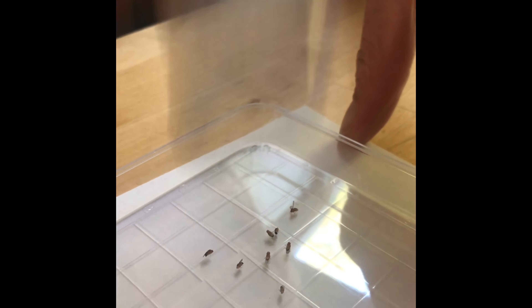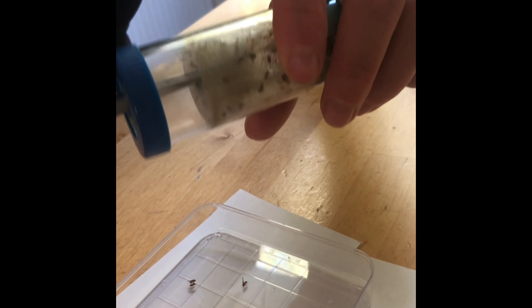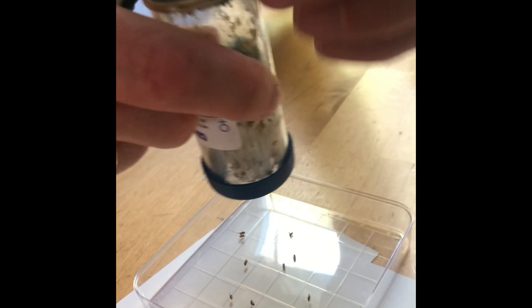I've got the cotton plug out. I have a square petri dish here with a white card inside because the contrast is going to help me see the flies. I'm going to tap the flies out of the vial — they still smell like fly nap. I might get a forceps and pull the mesh out. Moving the mesh should help, though it's harder than I anticipated.